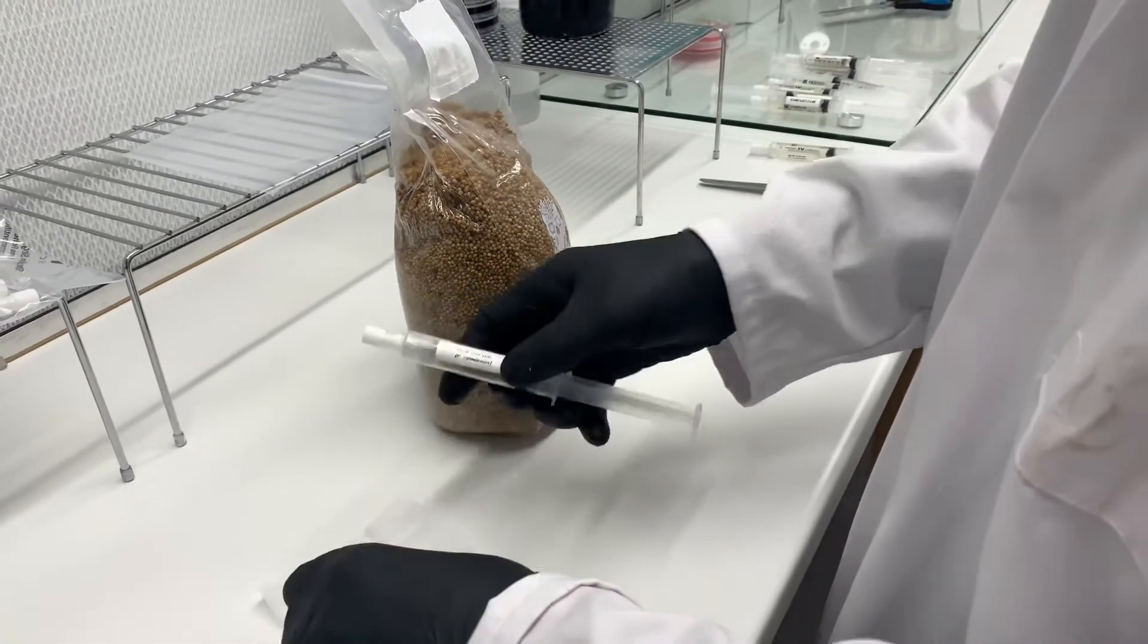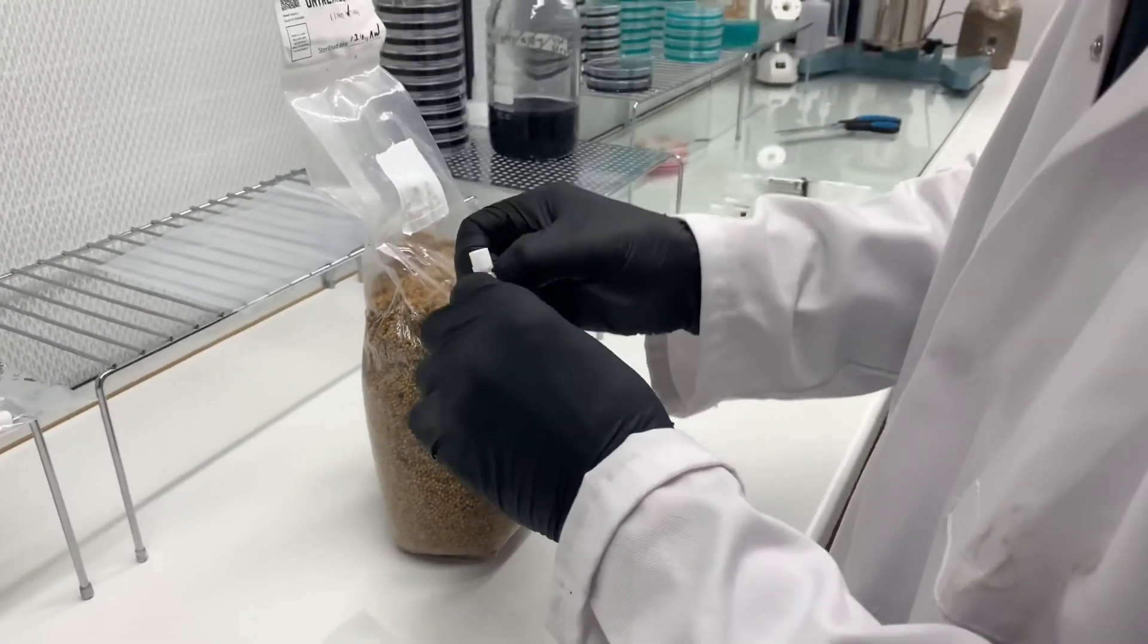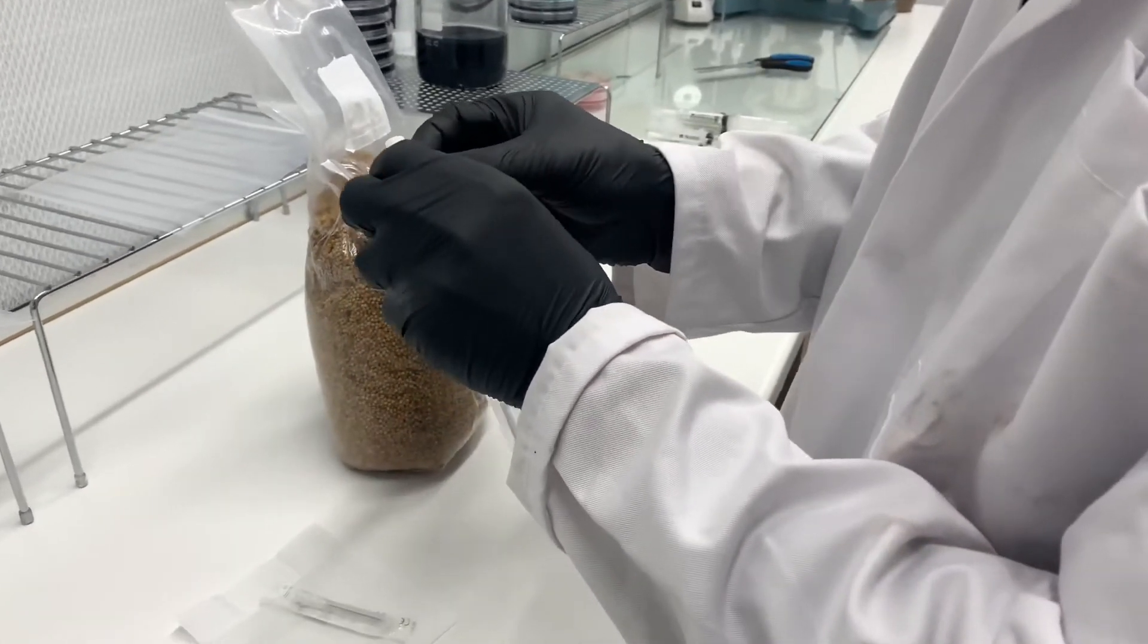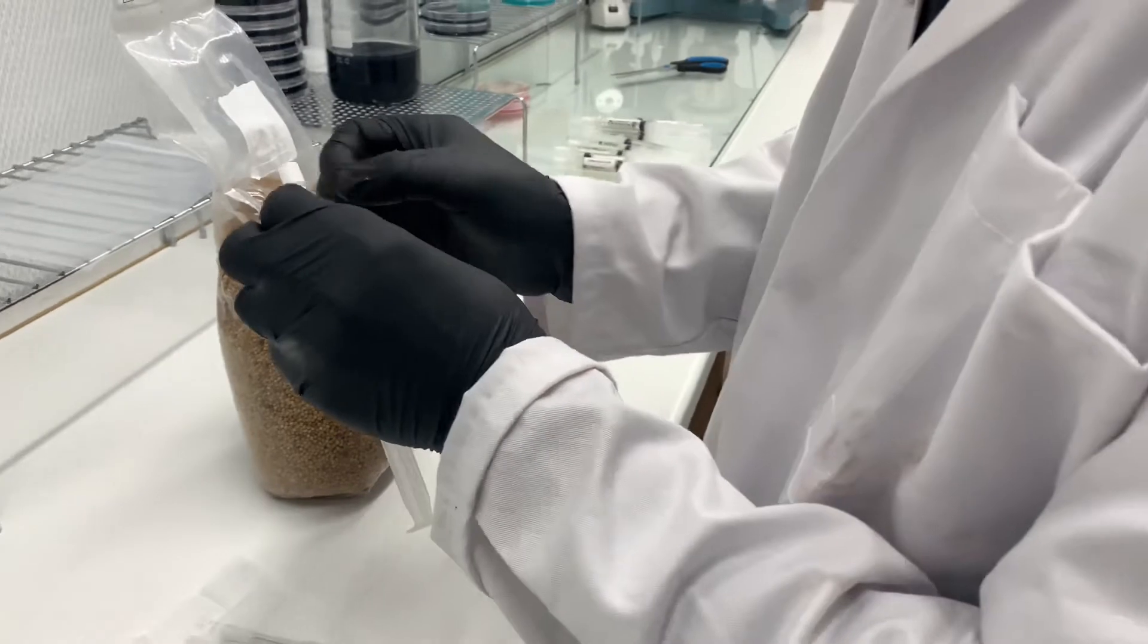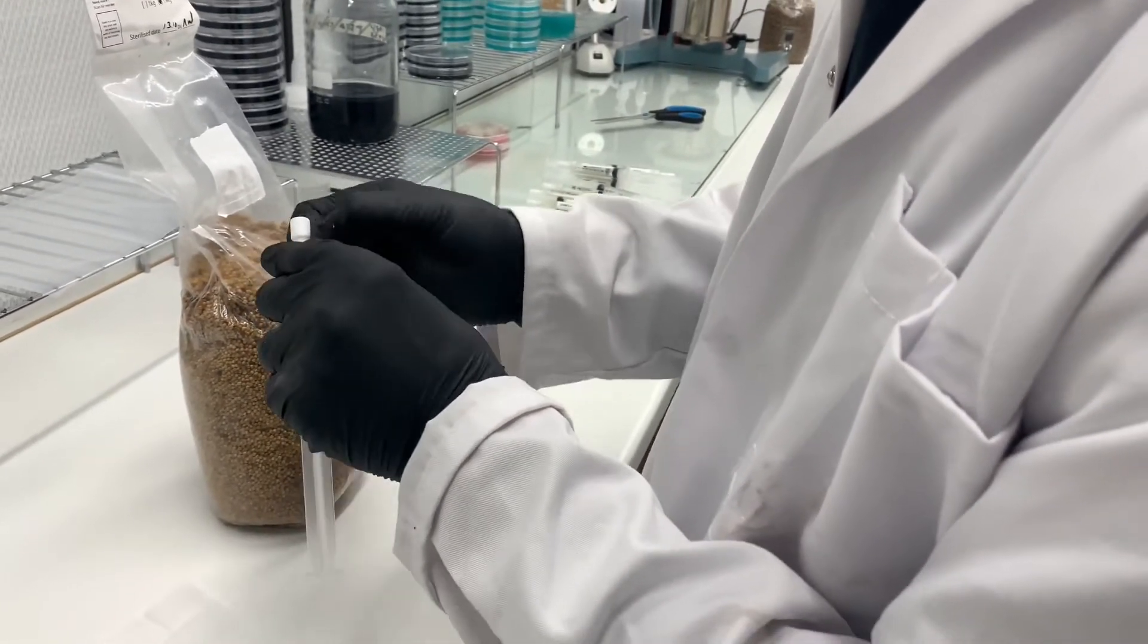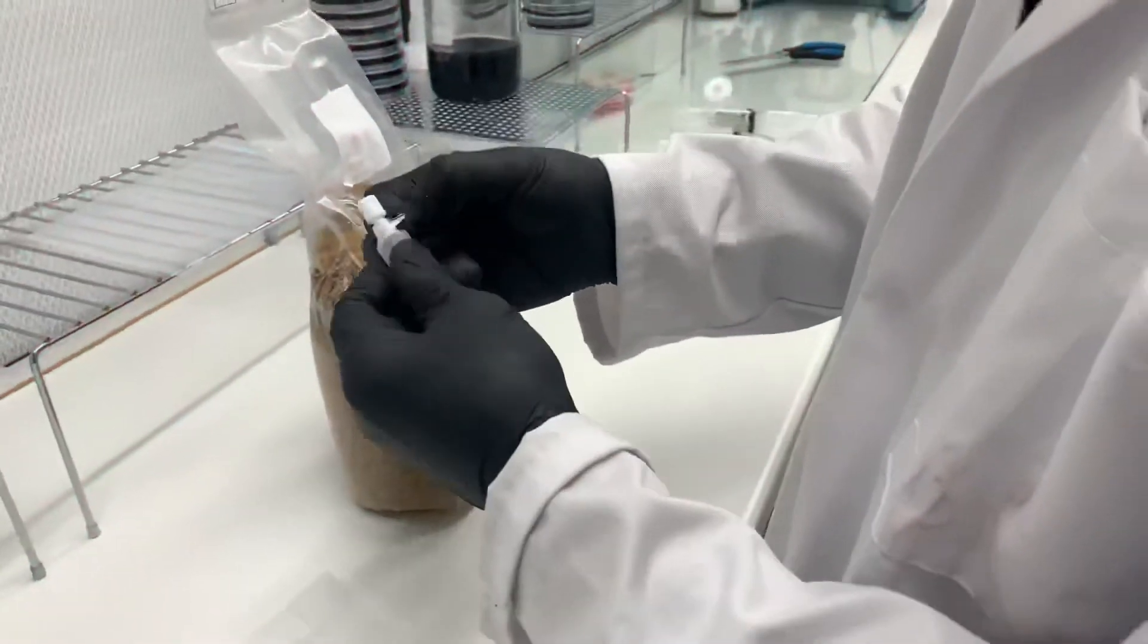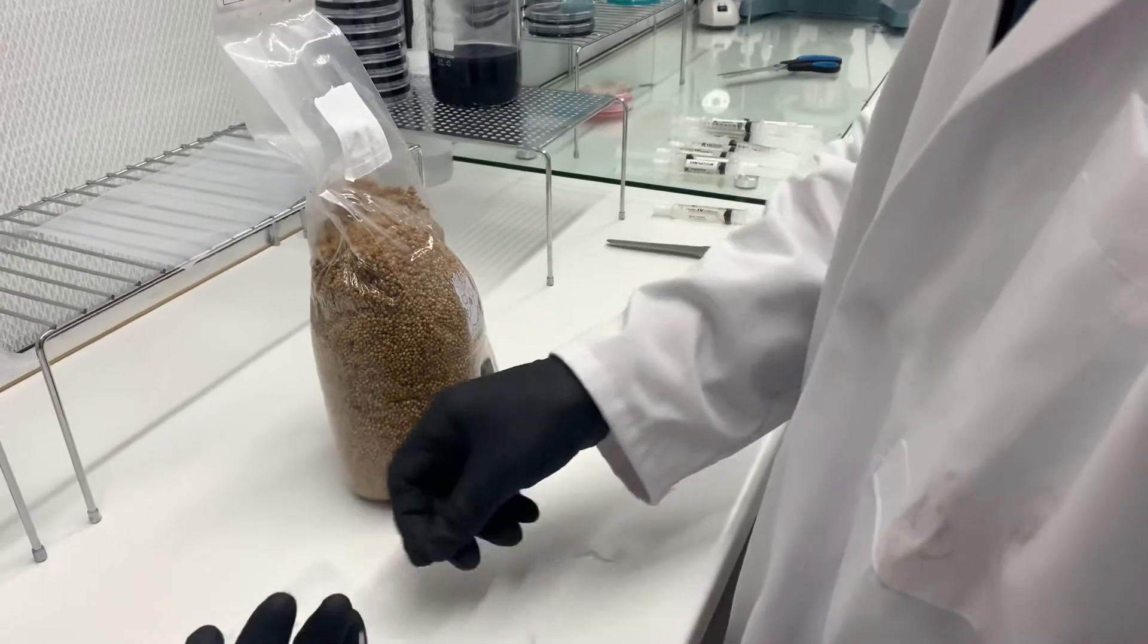So next we're going to try and take off the parafilm with gloves on, which is basically impossible. So yeah, I mean, I guess we'll just sit here and wait. There we go, all right, perfect.